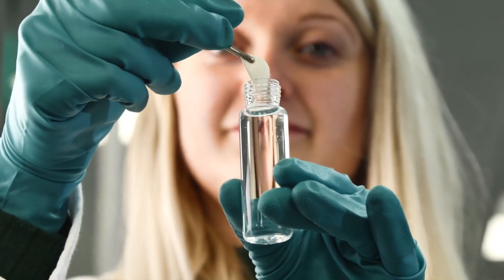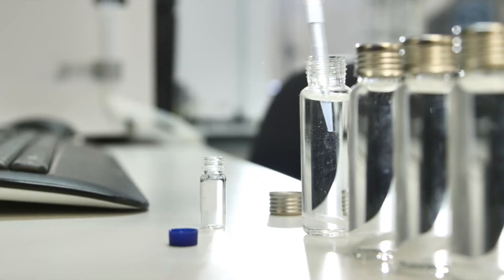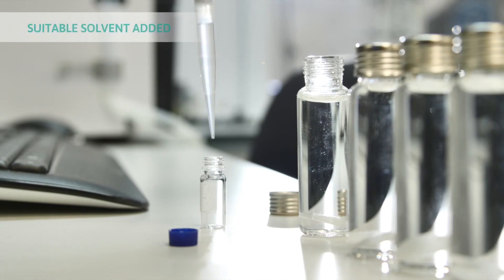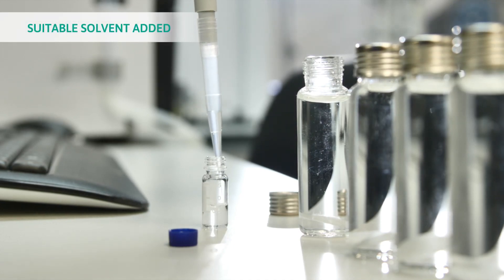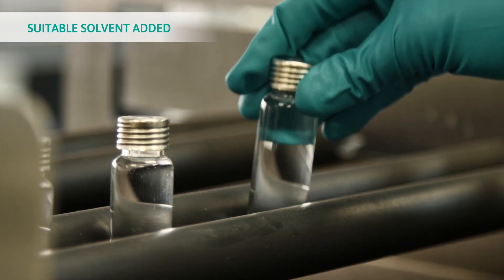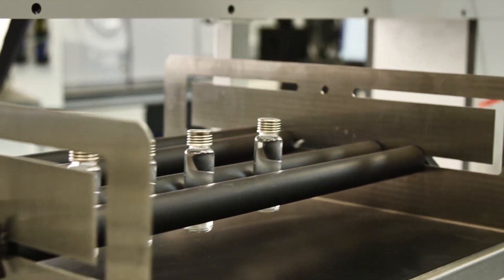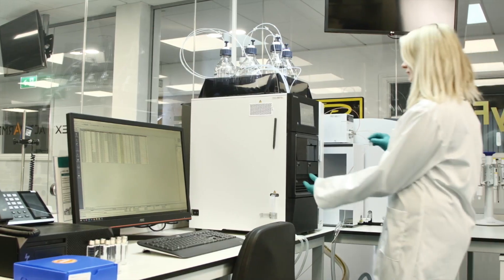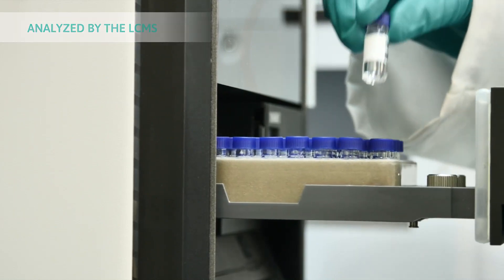At set time intervals the solid disc is removed from the cell and placed in a sample vial. A suitable solvent is added to the vial, which then removes the permeated chemical from the disc by dissolving it. Some of this liquid is then added to a smaller vial and this is then analysed by the LC-MS.